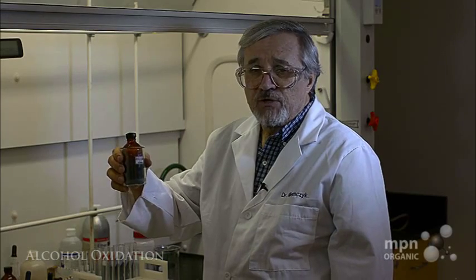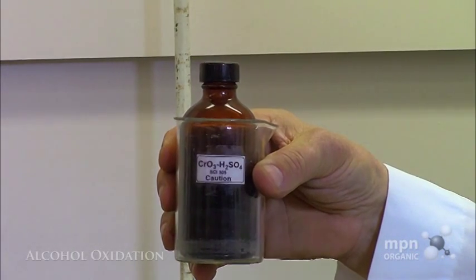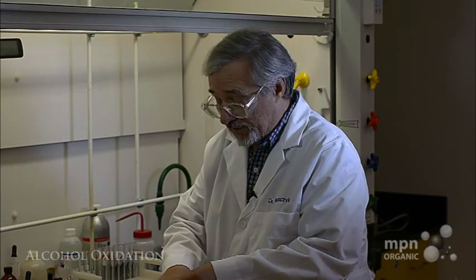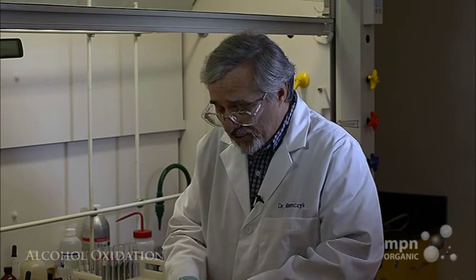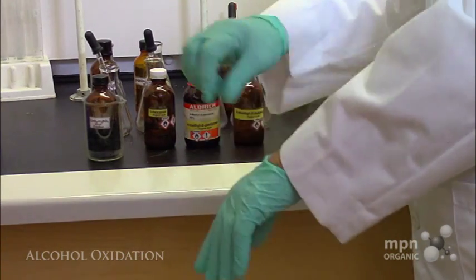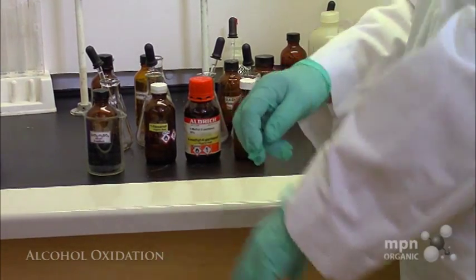Now this is chromic acid solution, and because it has a +6 oxidation state for the chromium, it is considered carcinogenic. So what you have to do when you run this test is to put on your safety gloves and safety glasses. And it's also probably pretty good, because there's sulfuric acid in there, to wear some kind of covering for your clothes. This stuff is very unforgiving. It gets on your clothes. You'll soon find, after a short while, some holes in it, and you can talk to my wife about this. She is very familiar with the holes that I've put in my clothes.